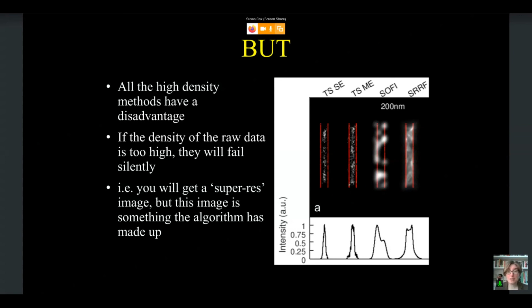So with ThunderSTORM single emitter, we get a very sharp peak here in the middle. ThunderSTORM multi-emitter, it's slightly wider. With SOFI, you can see that we get a very uneven distribution across the distance between the two lines, and we also get a lot of areas where we don't have any intensity. And then with SRRF, we get a roughly even fill between the two lines.